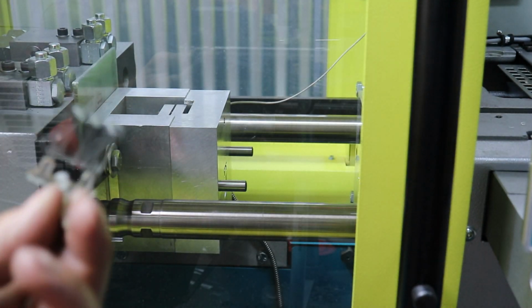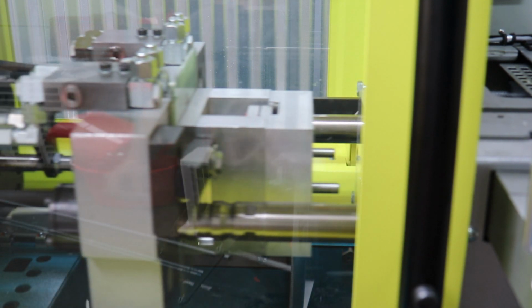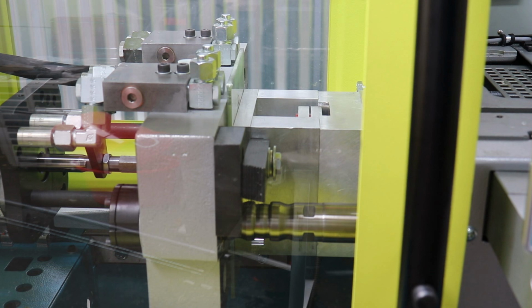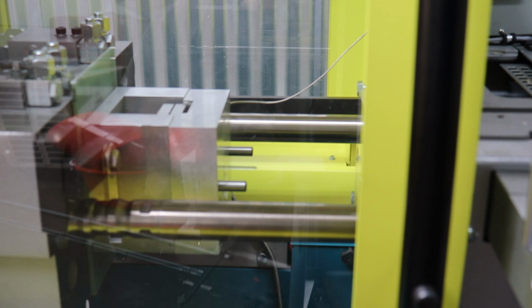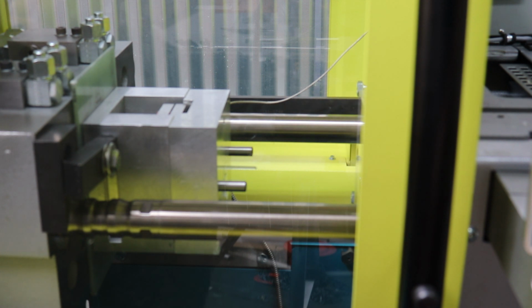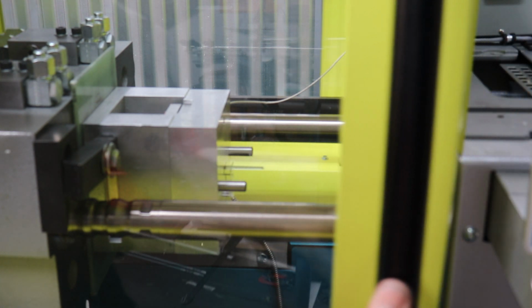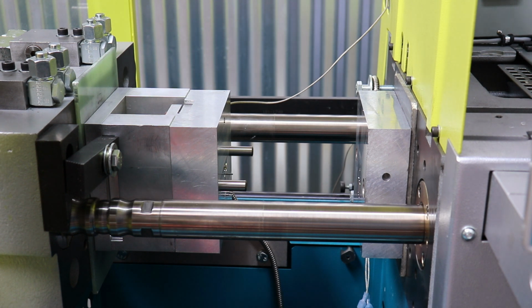So now I'll check it under the microscope, but what we want to do is really optimize the ejection of the part. So let's go ahead and hit the button again. A lot of times when you make changes, you need to run a dozen parts to really start to see the effect if you're making minor changes. But that was a pretty big change that we made, and it looks good. Yeah, it's not going to eject. All right, so I'm going to go to manual mode, ejector forward. Our ejection forward is at full travel right now, which is unfortunate.